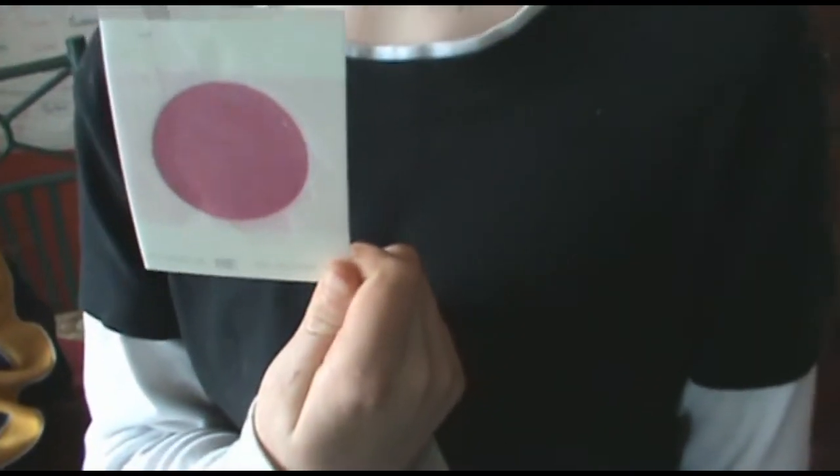And now here is your finished product. Now we have to put it in the incubator and we have to leave it for 24 hours, and then we will test it and check.